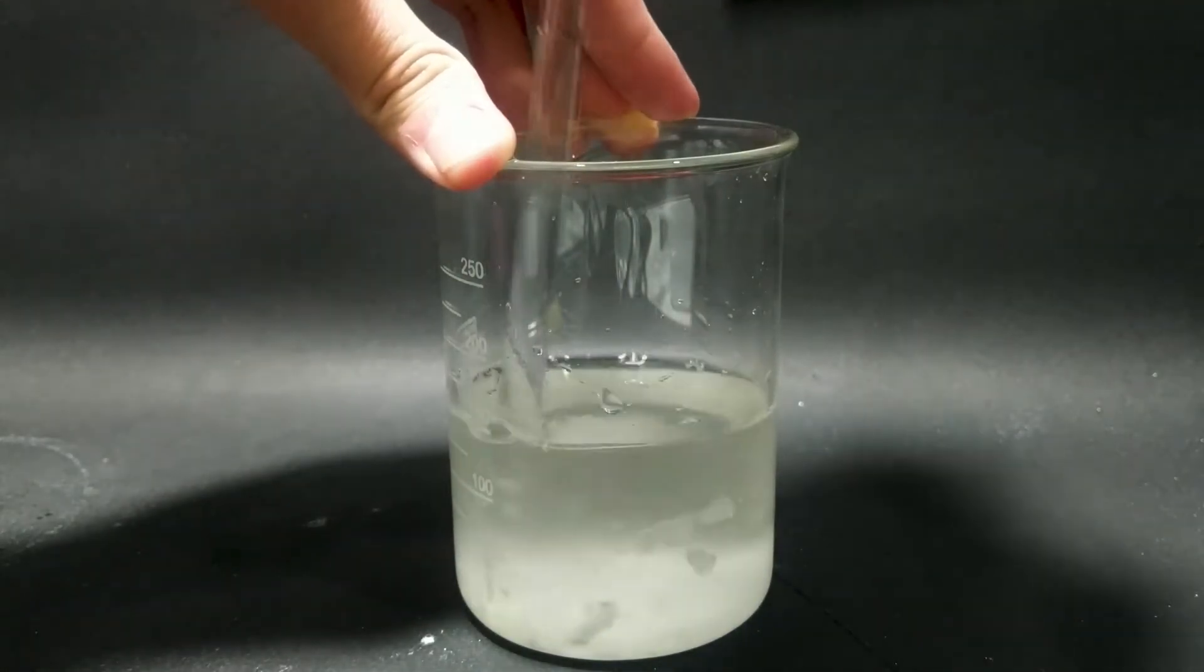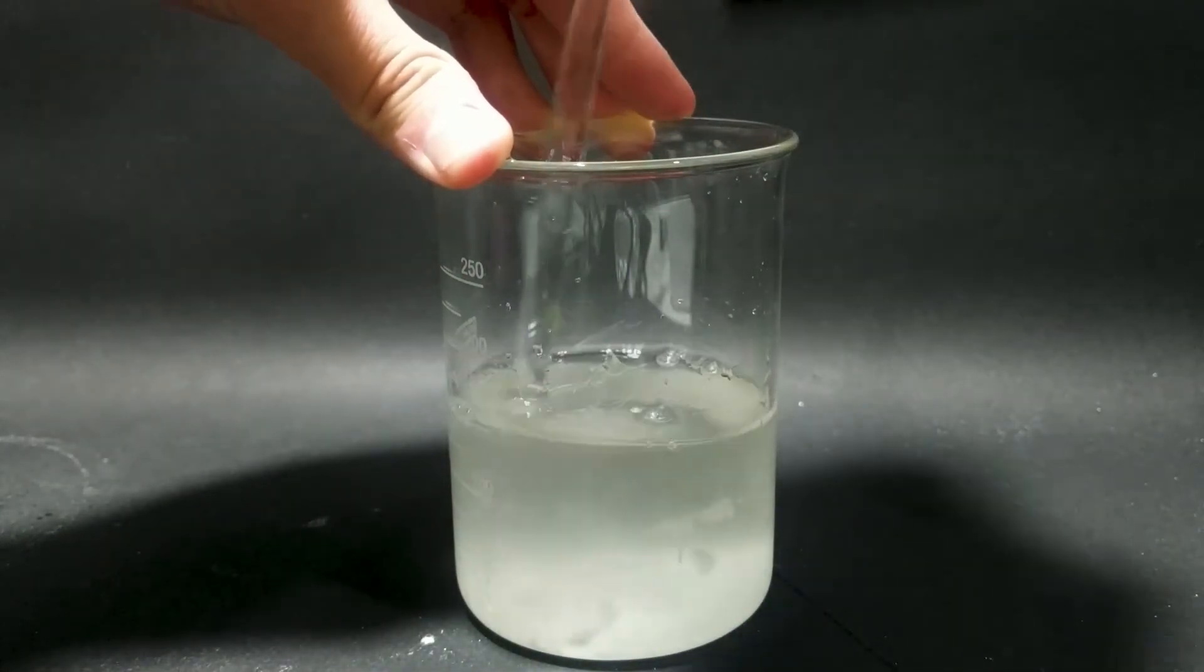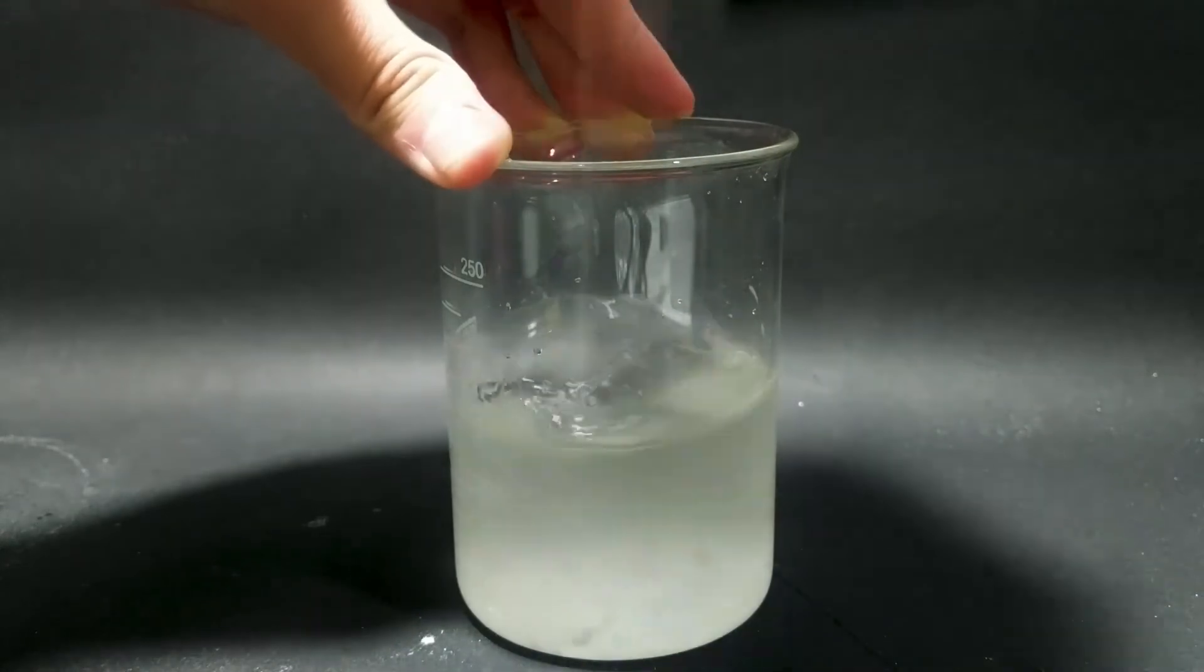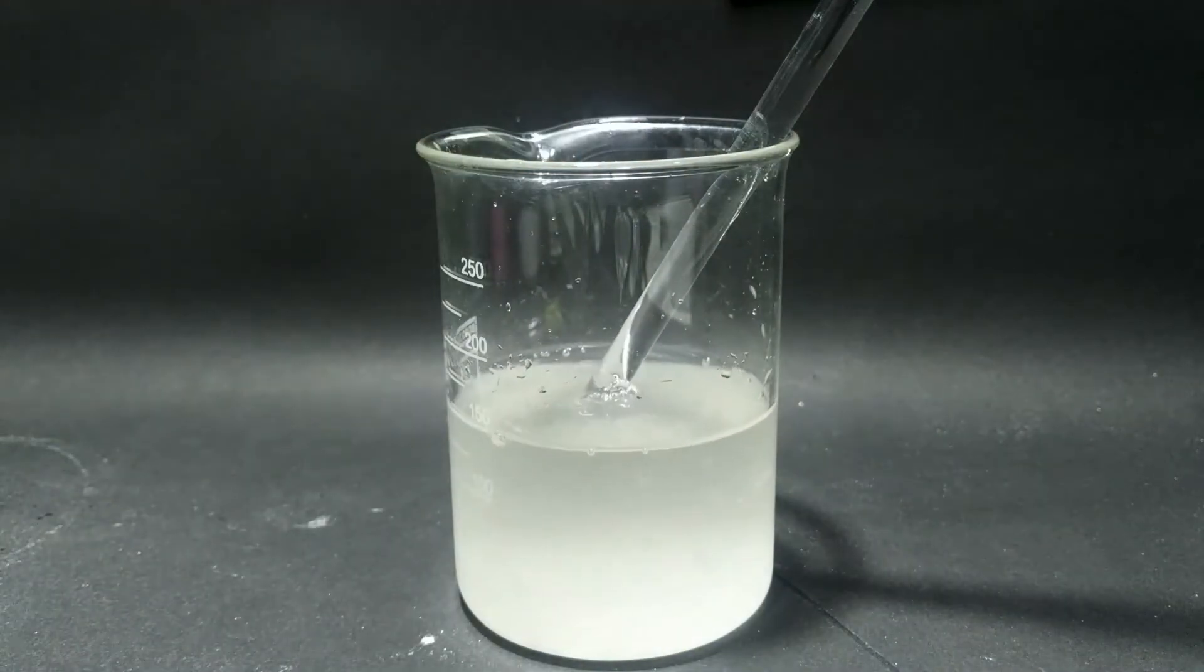Now the sodium citrate dihydrate is done. The yield is 90%, but considering some will need an anhydrous version of it, here I'm going to tell you how to achieve it.